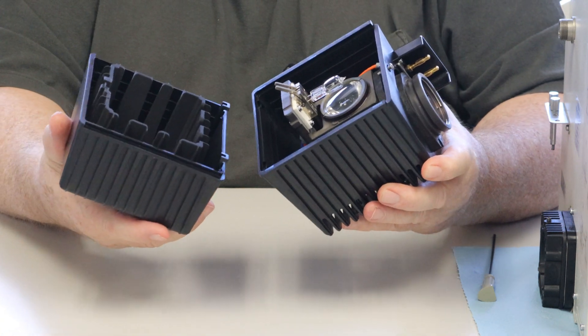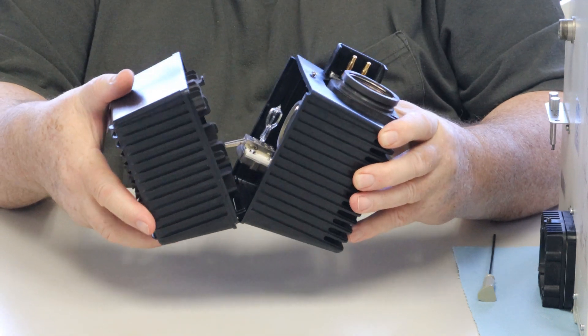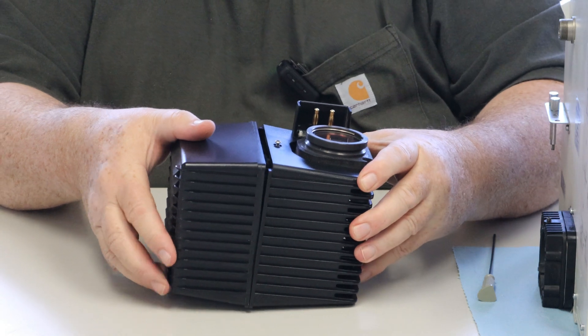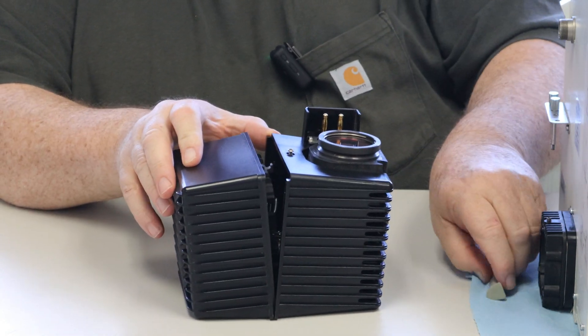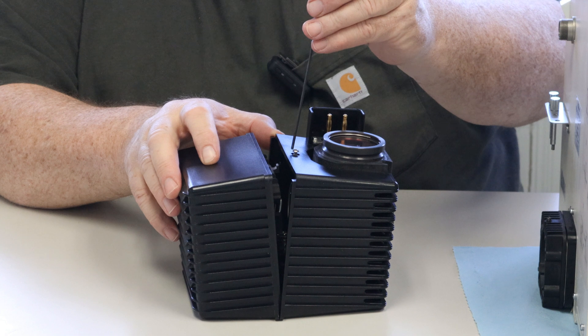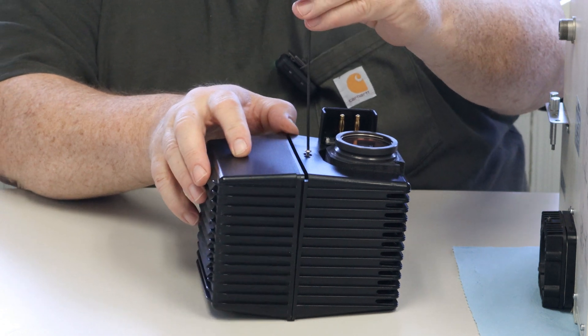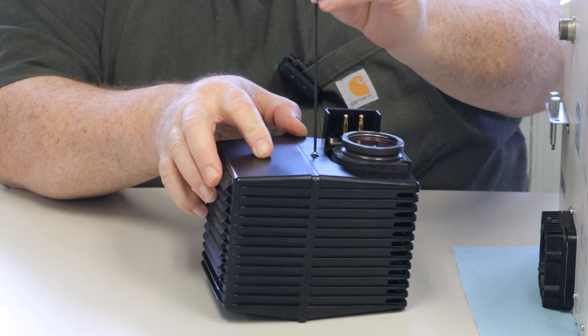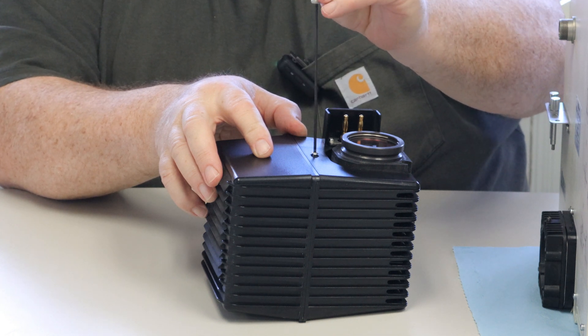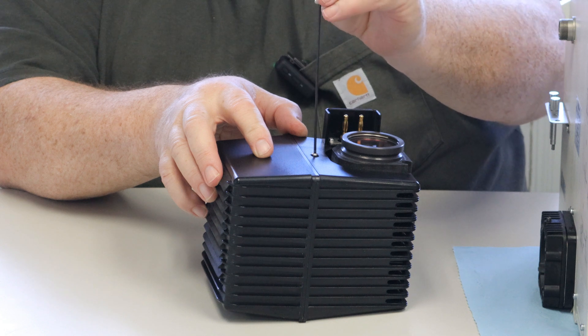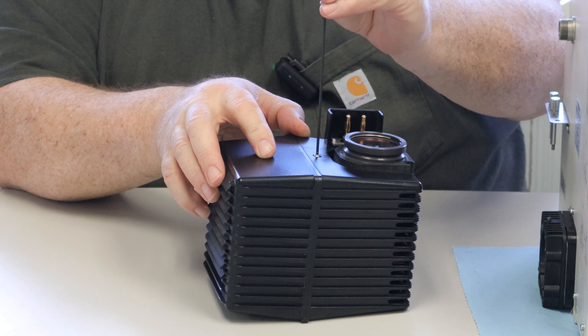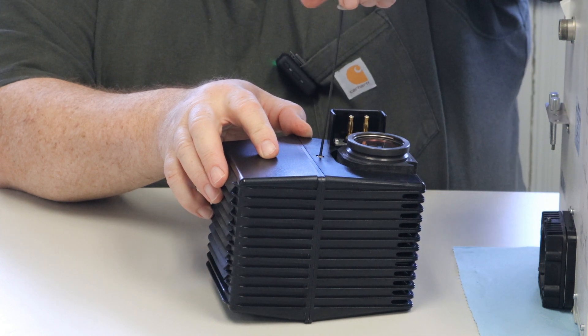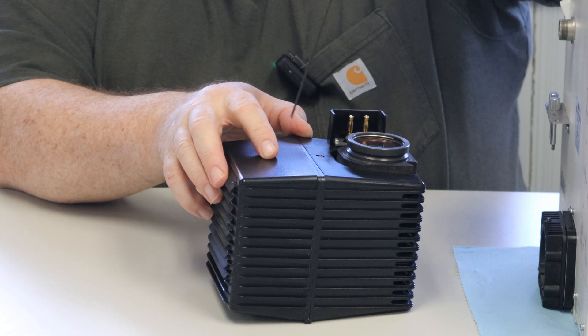Back to the little ears we have here. Goes in. Screw this down until it's tight. You don't have to put any foot pounds of torque. Just tight. There you go.